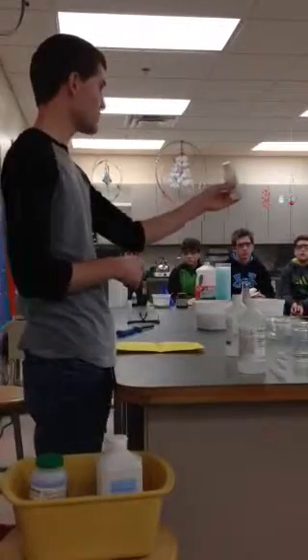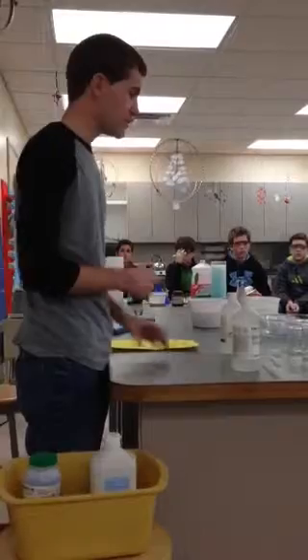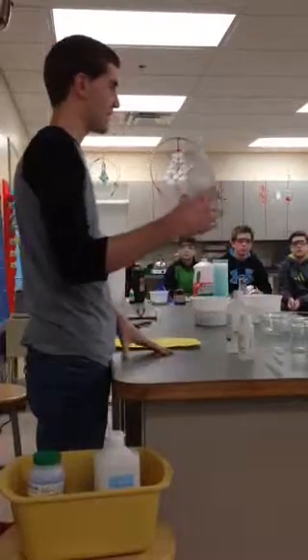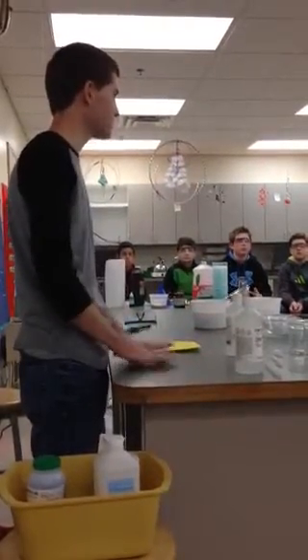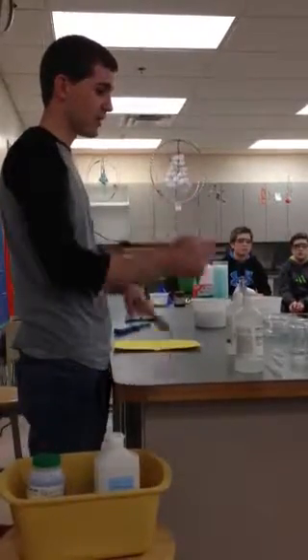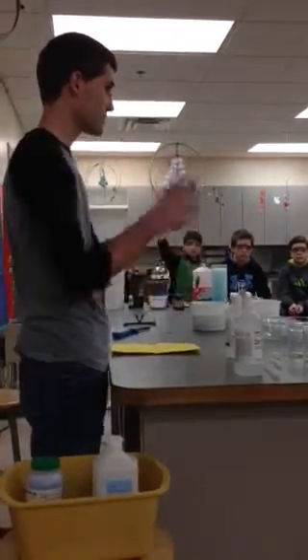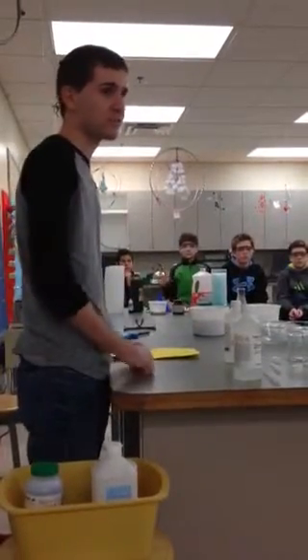And neutral means it's around what number? 7. So if I have a neutral state indicator, and then I've got sodium hydroxide and hydrochloric acid, what kind of reaction do you think I have going on? Yes, chemical. What's happening here? What's involved that's causing the color change? If we have an indicator, which indicates pH. Okay, exactly. So we have a pH change going on, right?